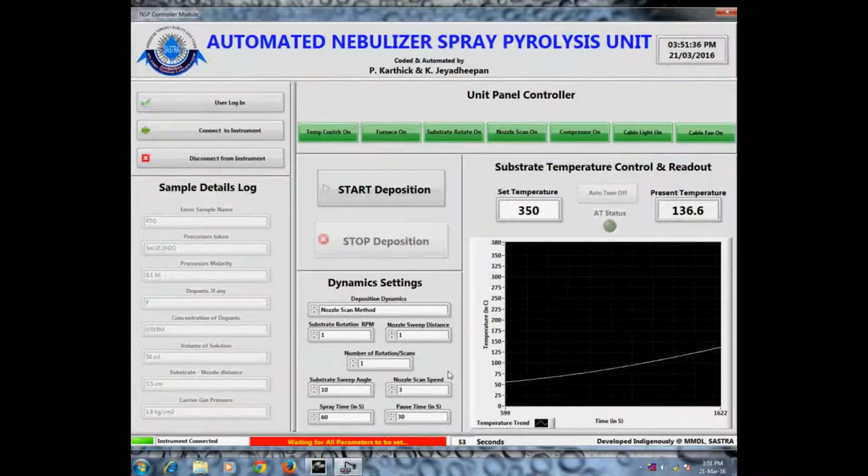As you can see in the graph, the temperature is increasing gradually. Right now itself, the start deposition control can be switched on, but the deposition will really start only when the substrate temperature is within plus or minus 3 degrees of the set point.